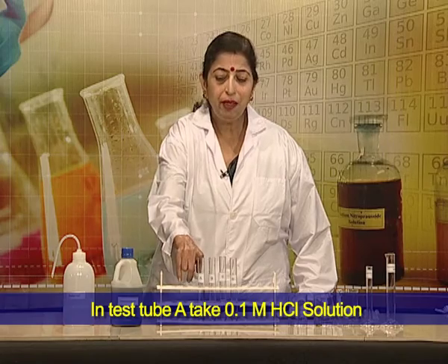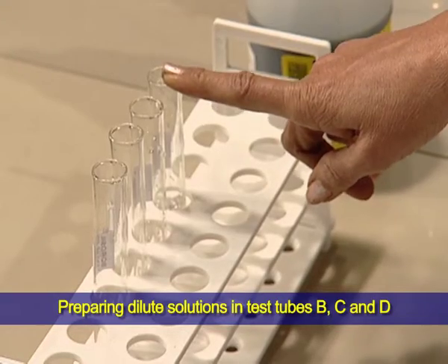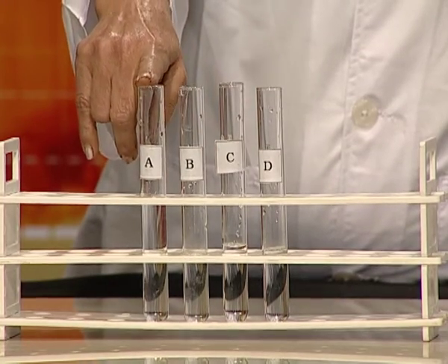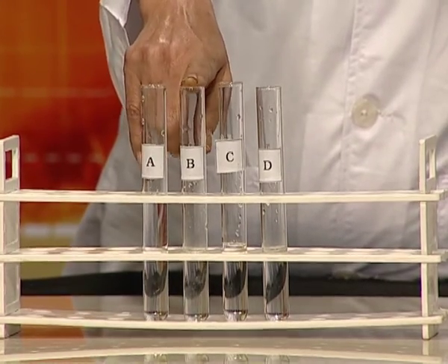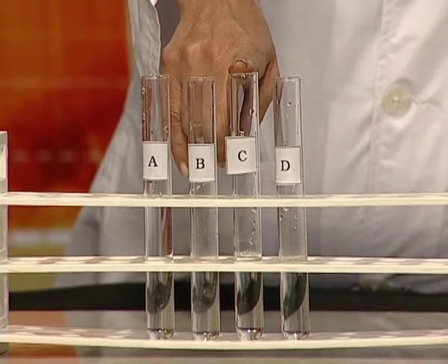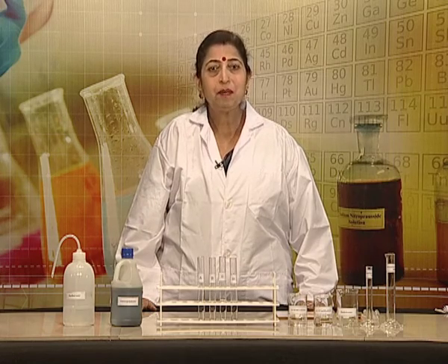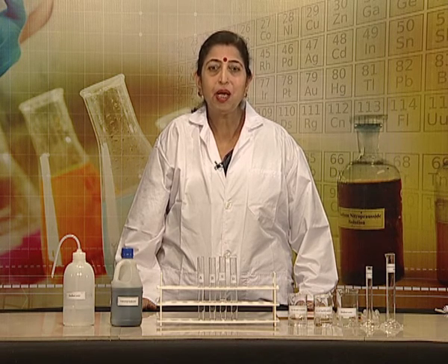In test tube A, we have 0.1 molar hydrochloric acid solution. Using this solution, we will prepare dilute solutions in test tubes B, C, and D. To prepare solution B, we are taking 0.1 ml of solution A, diluting it 100 times. From solution B, we take 0.1 ml, dilute it 100 times and prepare solution C. In the similar manner, solution D is prepared. Solution D is most diluted and solution A is least diluted.